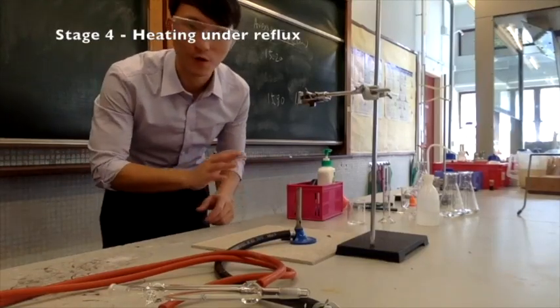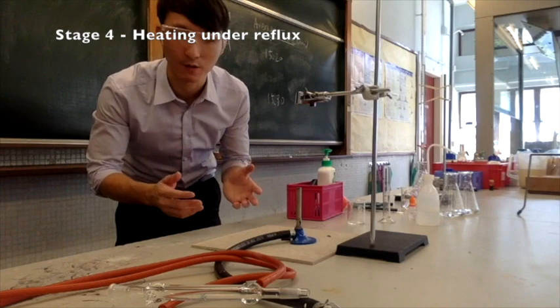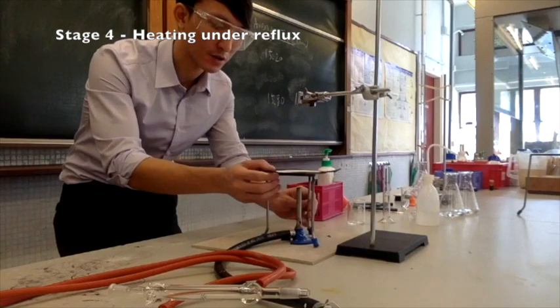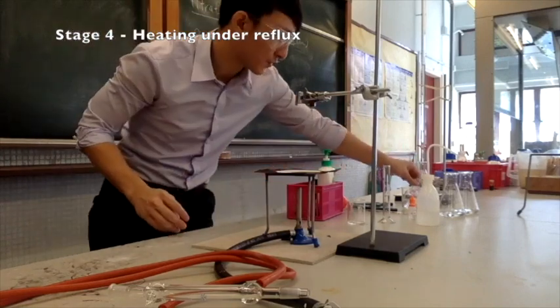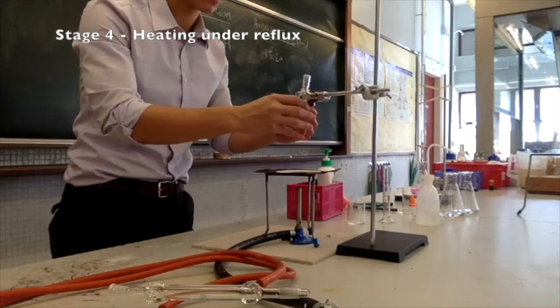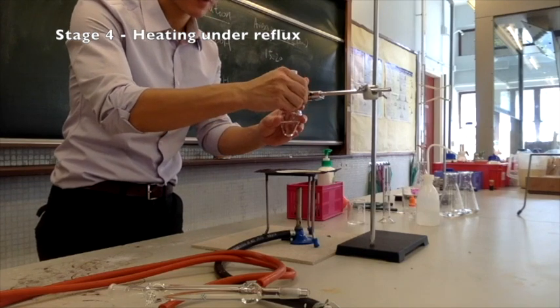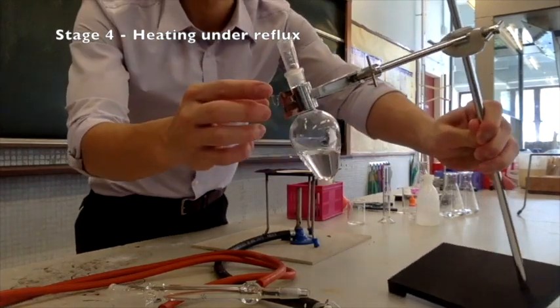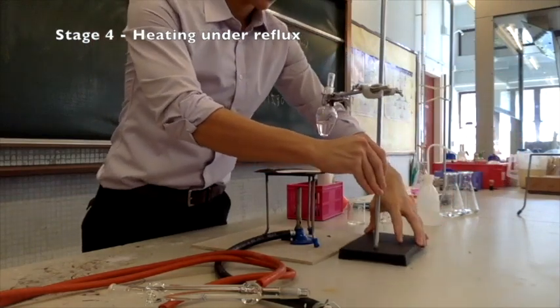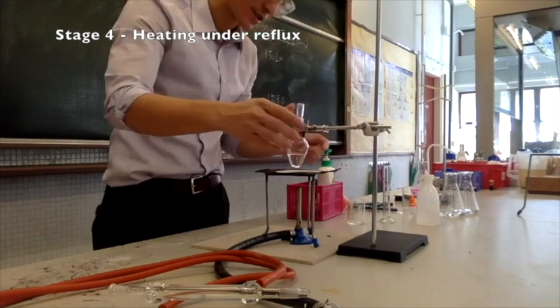Okay, entering stage 4, where we actually carry out our reflux. Make sure you know how to construct a reflux setup. First of all, we have the Bunsen burner, and we need a tripod and wire gauze, stand and clamp. Our pear-shaped flask here with our mixture, we will secure onto the clamp. Remember, when you are holding the pear-shaped flask, you should be holding the neck of the flask. So try to adjust it so that the flask is touching the wire gauze.